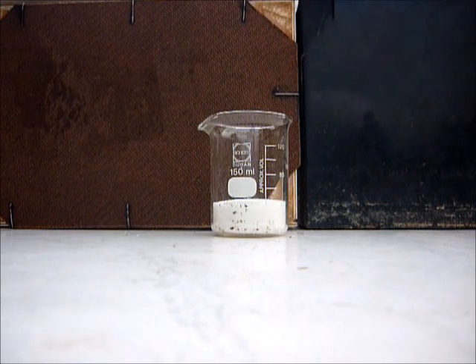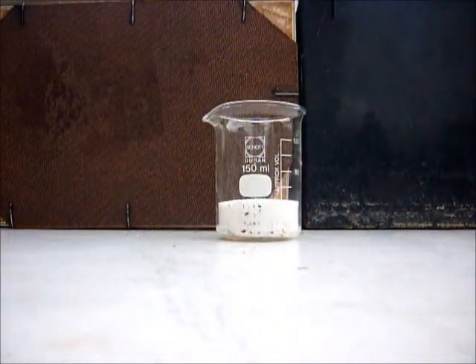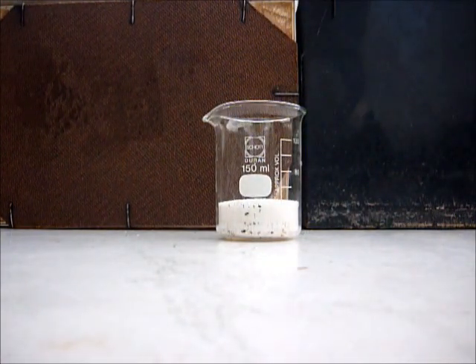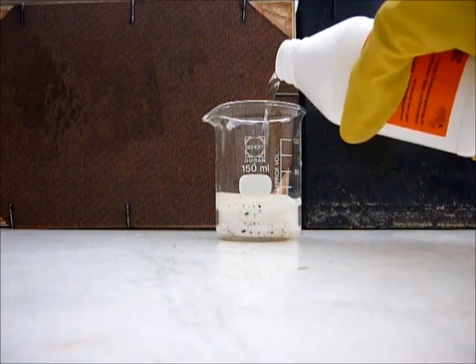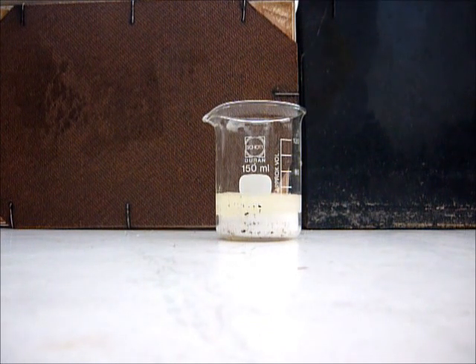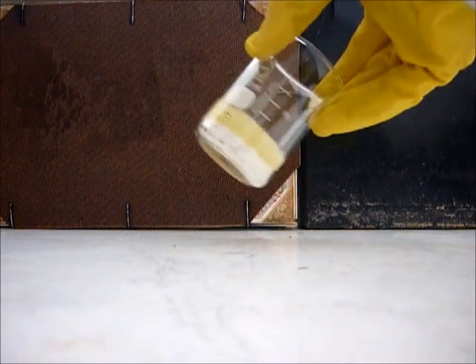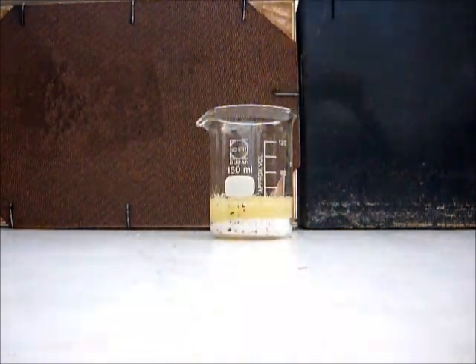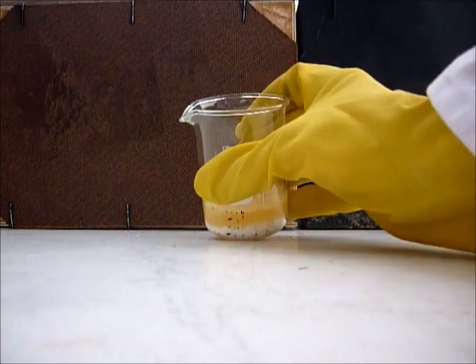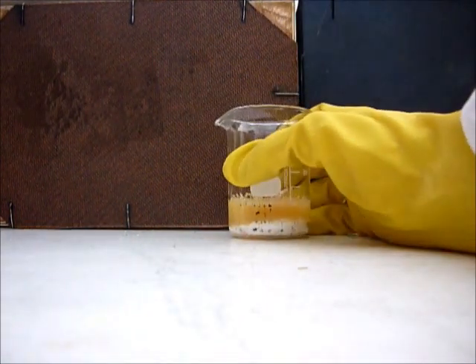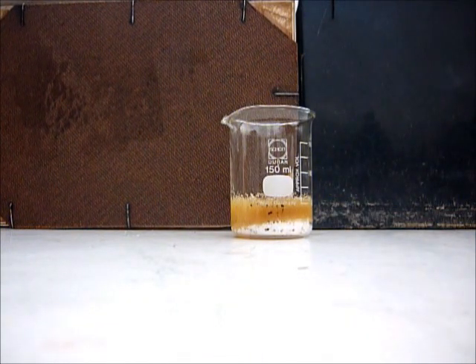This is household normal sugar and I will put some sulfuric acid on it. So this is enough. Don't forget to close the bottle. Now we will see what happens when the sulfuric acid dehydrates the sugar. We must wait a little bit.